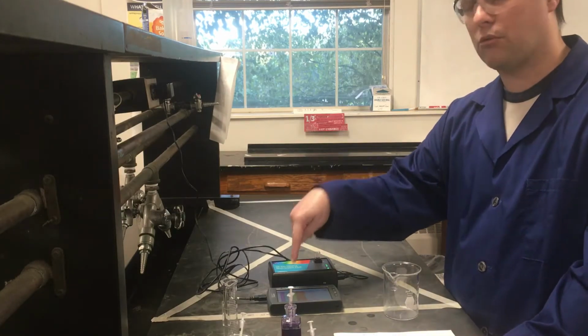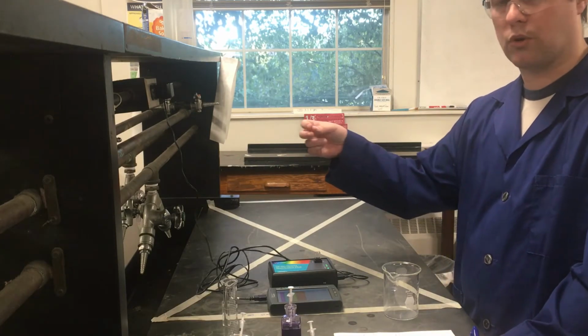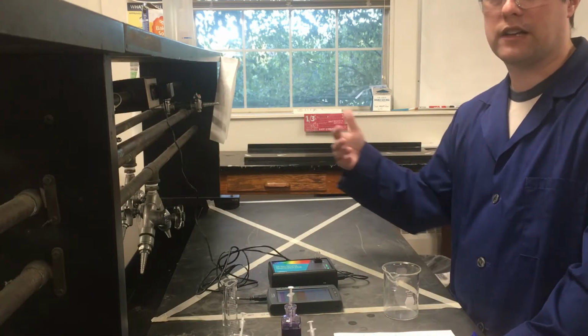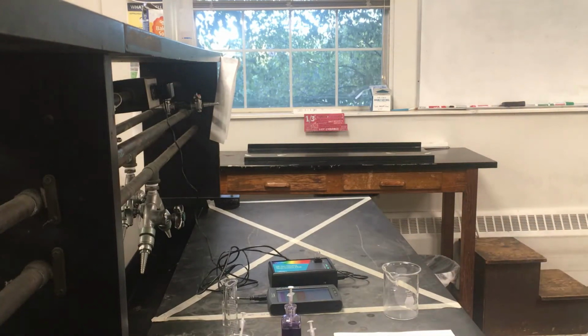And now when I go to my second part of the experiment, I want to remember that value, because if that's where our crystal violet dye absorbs the best, that's where we want to be looking when we measure the absorbance for future solutions, where we're going to vary the concentration and look at how that absorbance actually changes with concentration. So that's going to be the second part of our experiment that we're going to move into next.